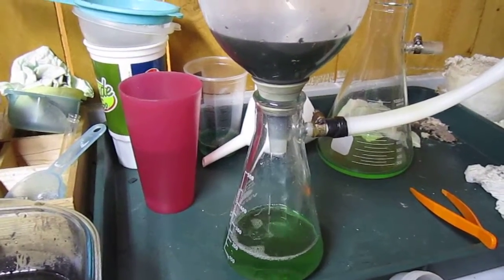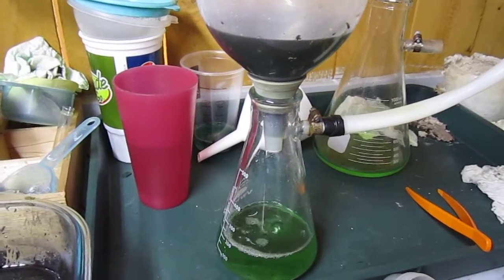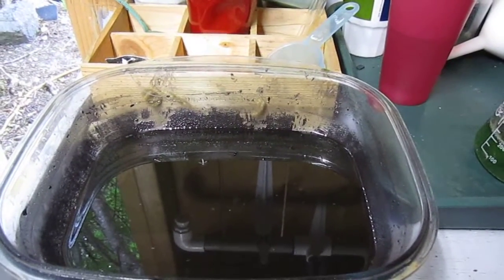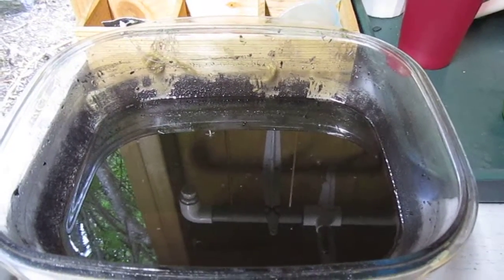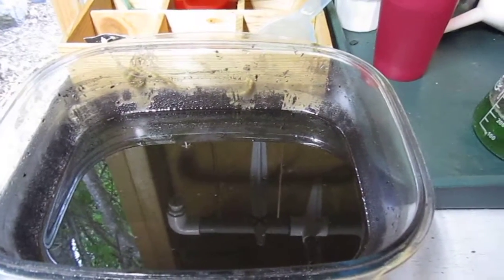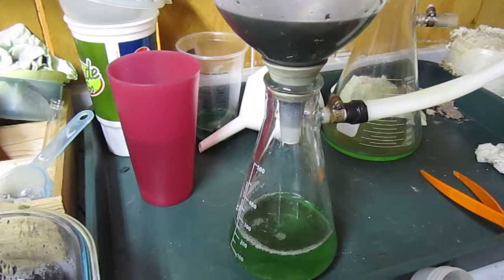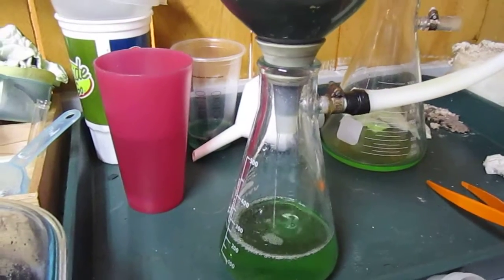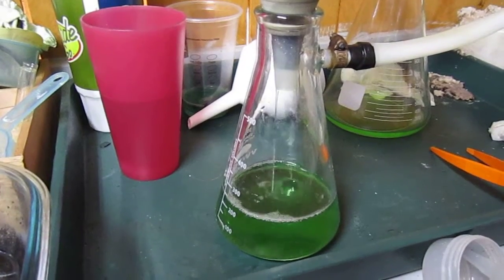This is sulfuric acid being vacuum filtered. The acid that has been used in the sulfuric cell produces a black gold sludge. I let it settle overnight, and in the morning I filter it away. I use a fiberglass plug and it cleans it up pretty good.